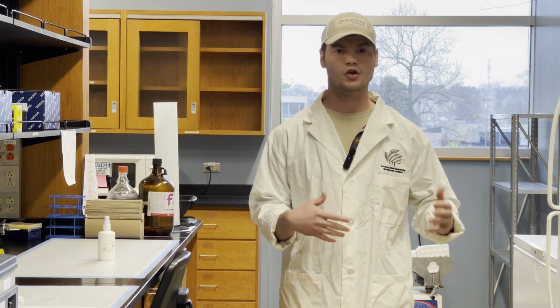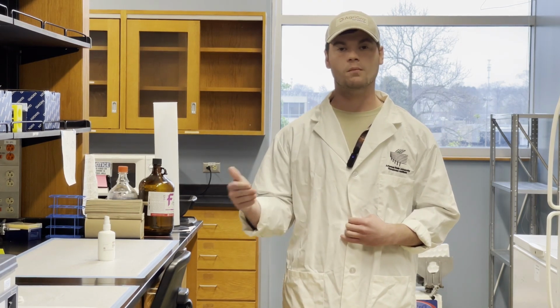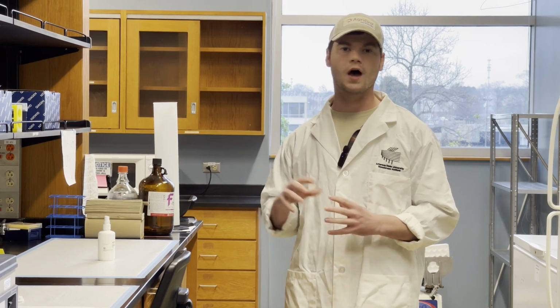When we want to look at bacteria or fungi or other eukaryotes or prokaryotes that comprise a microbiome, we use marker genes that allow us to amplify that gene for all microbes in a biological sample, and then we leverage hypervariable regions to classify taxonomy. This is a really good approach to get a zoomed out view of what's going on in the microbiome.